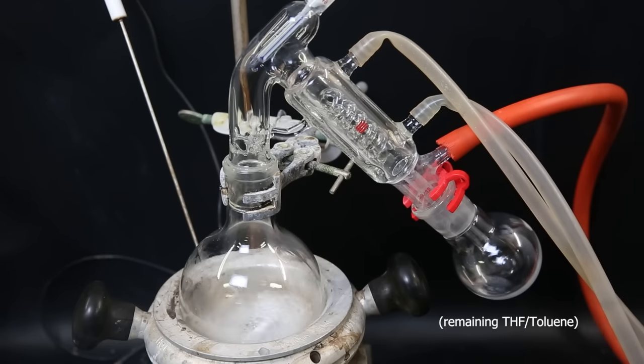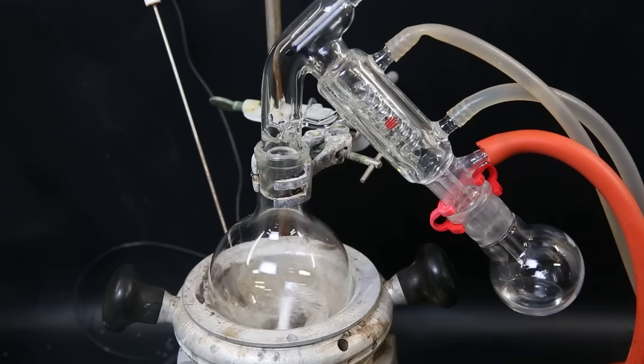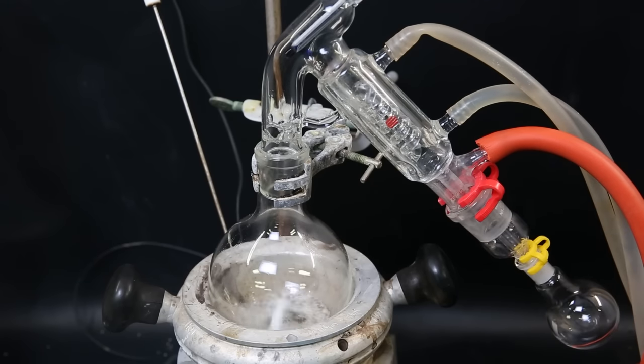I then pull a light vacuum on the setup and more comes over. When all of that has come over, I swap the receiving flask again.